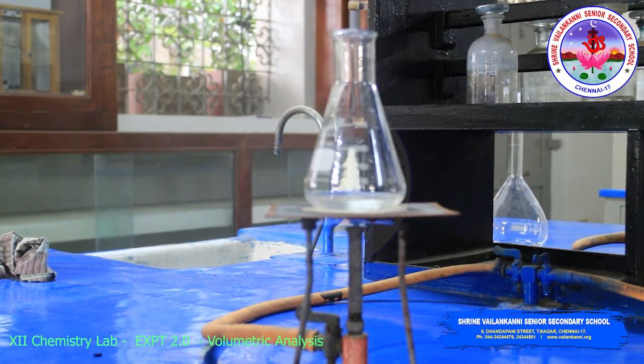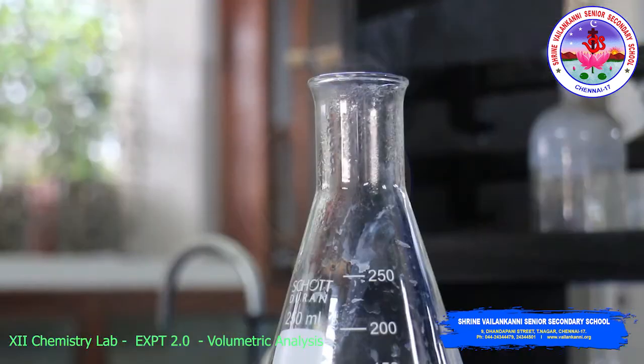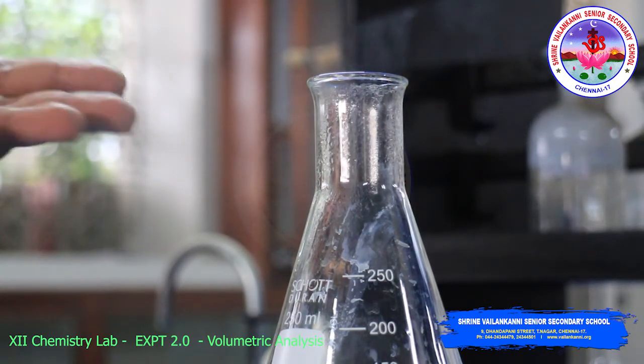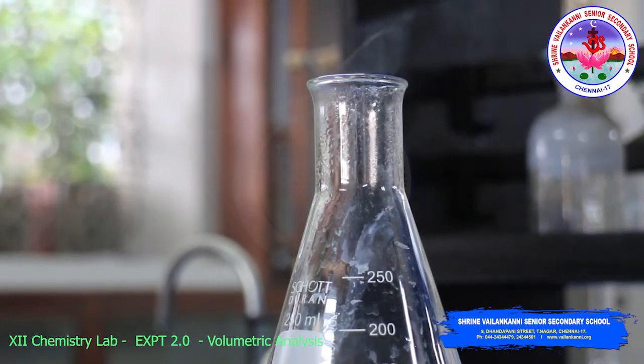After a few minutes the vapors are coming out, that is carbon dioxide gas. Then you have to titrate. Now can you see the vapor, students? Look at the conical flask. The carbon dioxide gases are coming out. Can you see this?